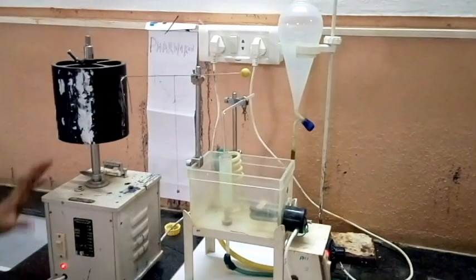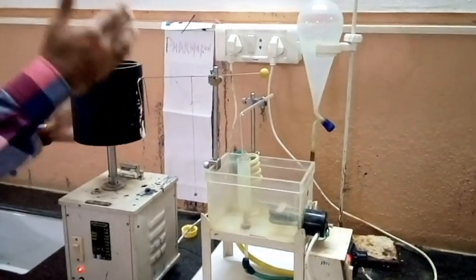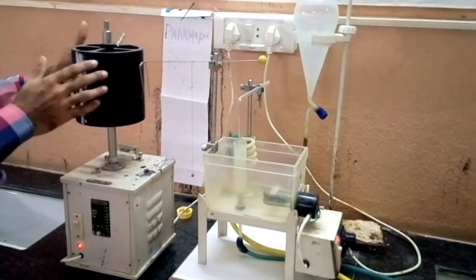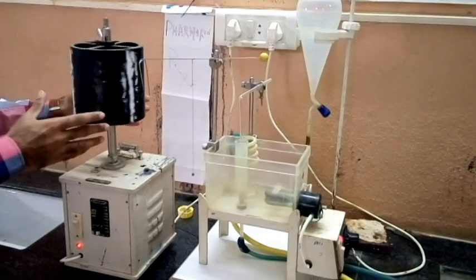Once I turn on the rotating drum, the rotating drum moves and the lever keeps recording different values and readings. As the tissue contracts and relaxes, different readings are taken upon the rotating drum.